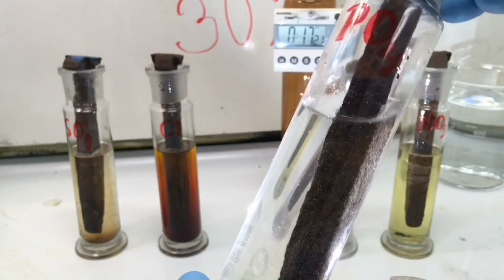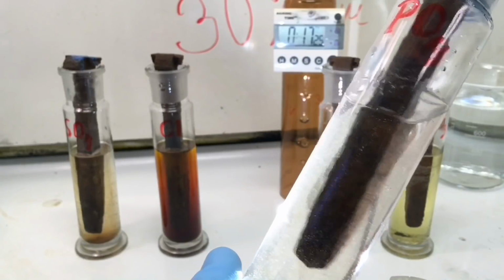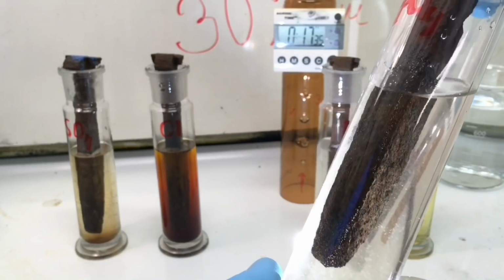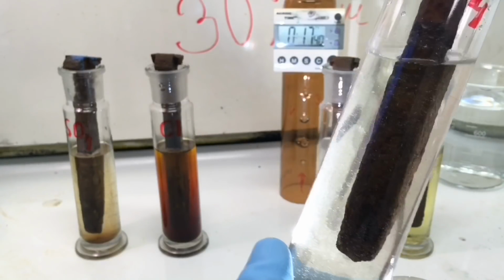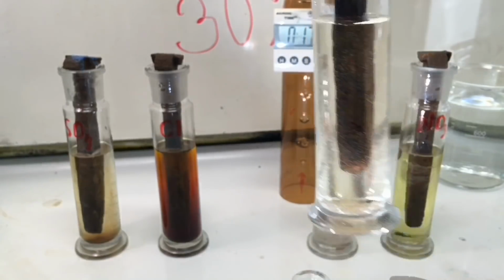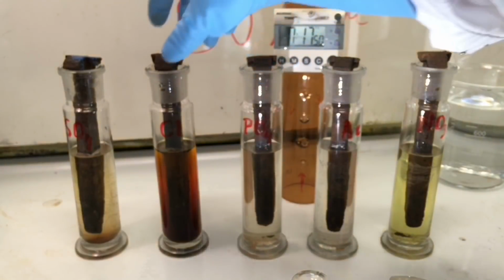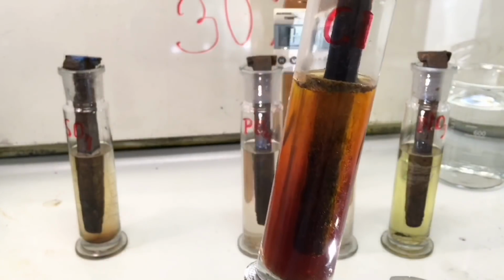Phosphoric acid, shake it, some flakes falling off. The solution is slightly brownish, but after 15 minutes it's actually mostly transparent. And this is for a solution that is stronger than what you buy as a rust eater in your car shop. Now we take a look at the hydrochloric acid.